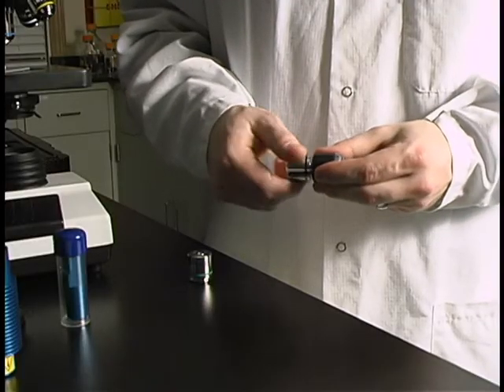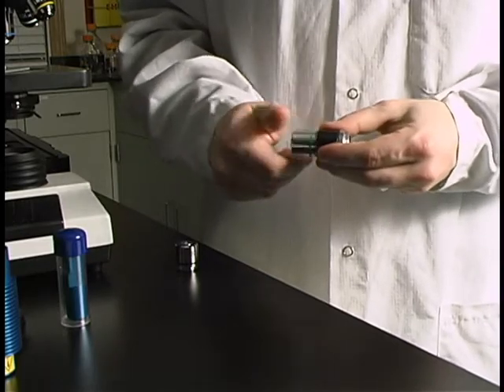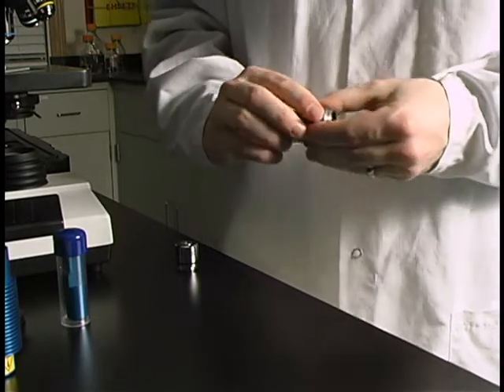If you would like to use an objective which is different from the one attached, simply unscrew the current objective from the body and replace with the desired magnification.